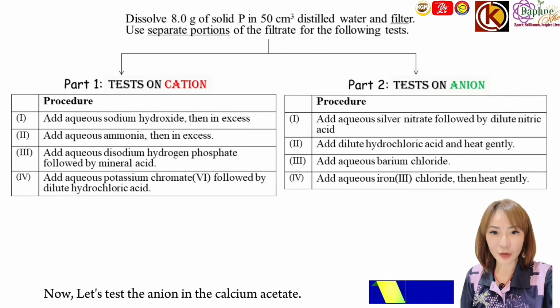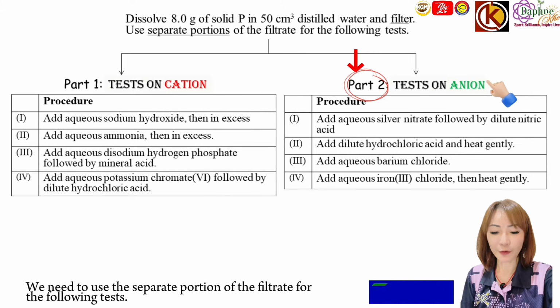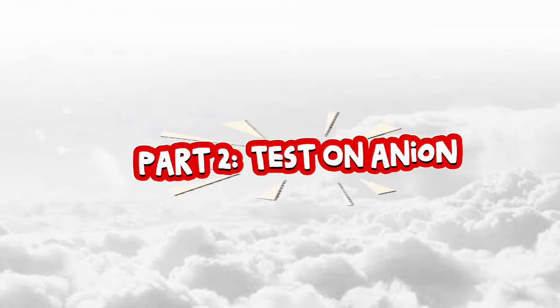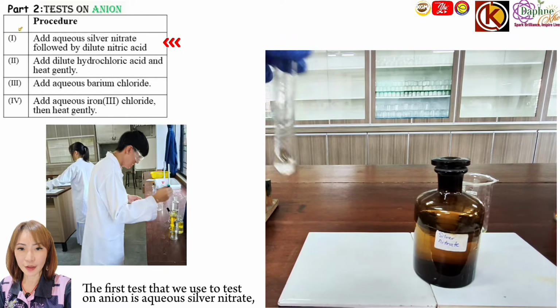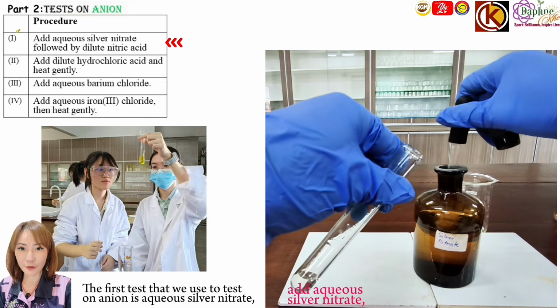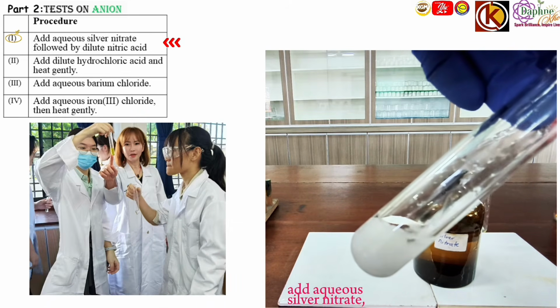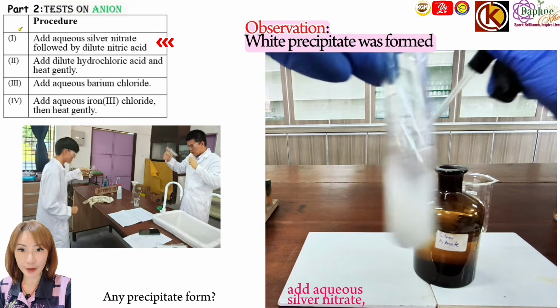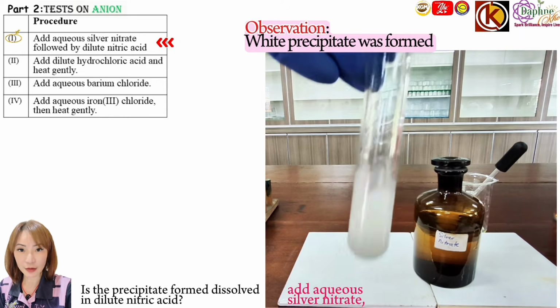Now, let's test for the anion in the calcium acetate. The ion here is the acetate ion. We need to use separate portions of the filtrate for the following tests. The first test that we use to test for the anion is aqueous silver nitrate followed by dilute nitric acid. What are your observations? Is any precipitate formed? Is the precipitate formed dissolved in dilute nitric acid?